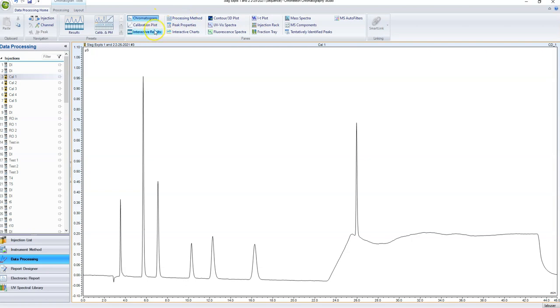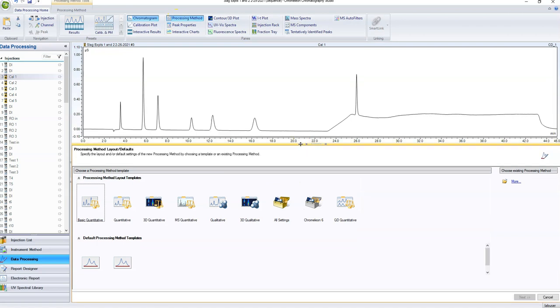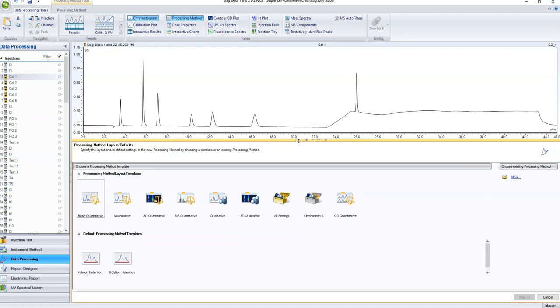So the very first thing that we need to mess with is the processing method. Now this is one of the most difficult things to mess with. If you are using the exact same calibration curve as somebody else, and you are measuring the exact same things as somebody else, you can use their processing method. But if you have made a calibration curve that uses any different points from their processing method, do not use their processing method. You have to make your own. If you use their processing method and you change it to fit your calibration curve, you are messing up all of their data and you're changing their processing method in their files at the same time as you're changing it in your files.